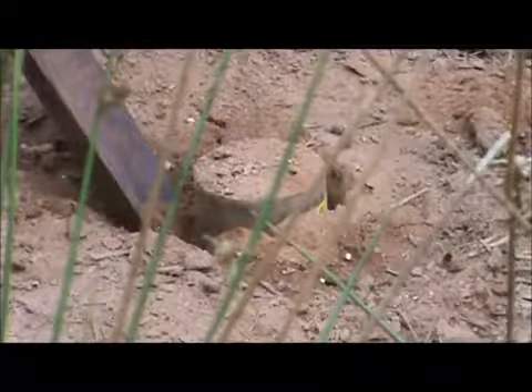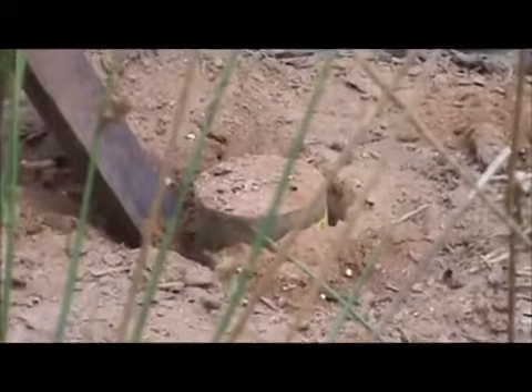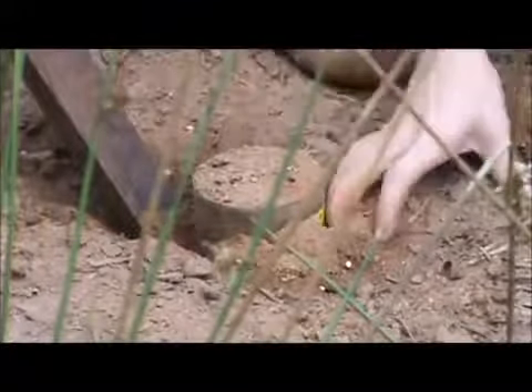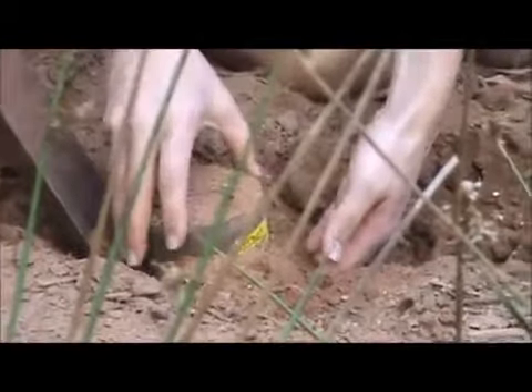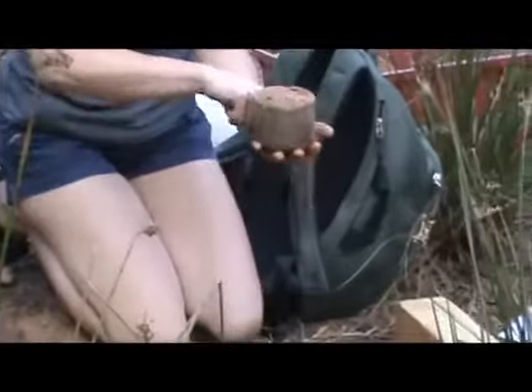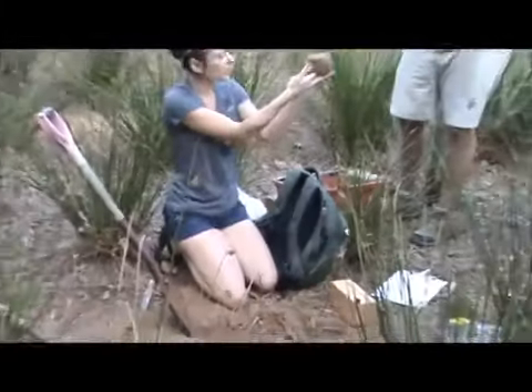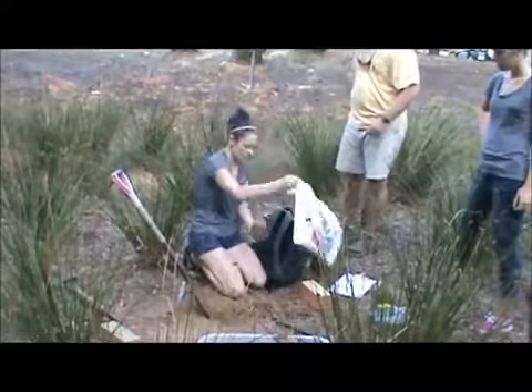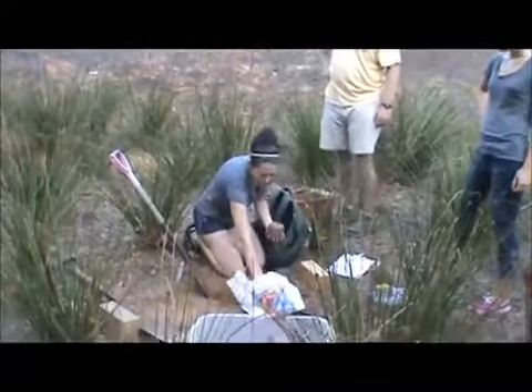This is like a floodplain — just sediment that was brought here. We came out here earlier to see how to try to take samples. What you're going to want to do is take your hand and scoop way underneath the ring, just to make sure that you have below the level of the ring. Then you're going to grab the cheesecloth, which is in here.